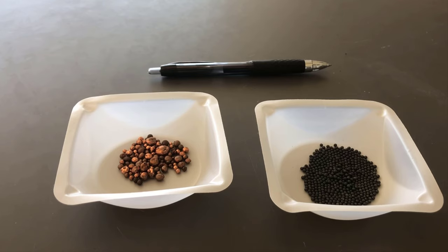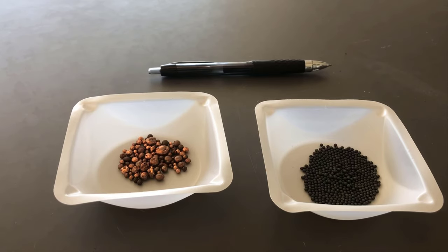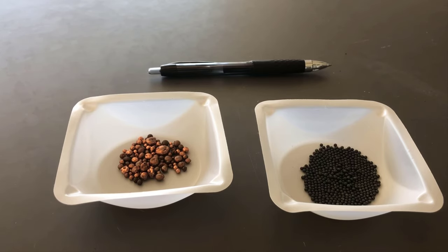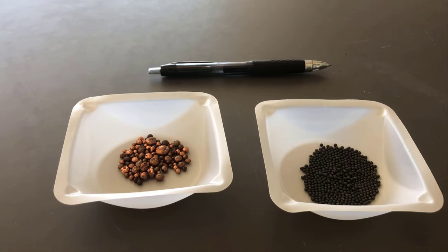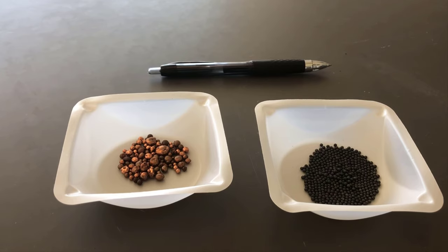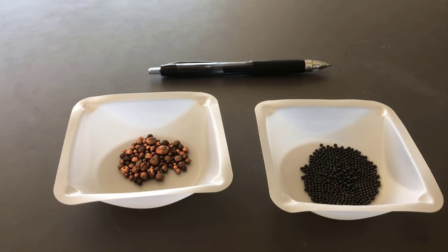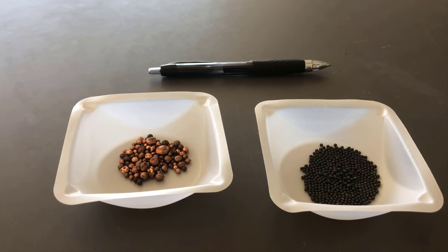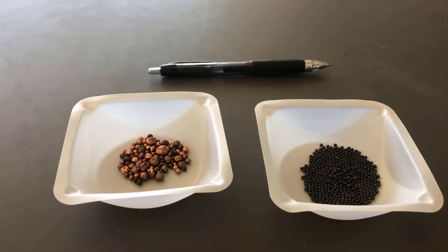Hopefully you've had a chance to have a look at the procedure — we'll get right on with it. The plan is that we're first going to heat a measured quantity of one of these metals, then add that heated metal to a measured quantity of water at a known temperature. One of these two substances is going to lose heat and the other will gain heat, because heat always flows from an area of higher temperature to an area of lower temperature. Furthermore, the heat lost by one substance is going to be equal to the heat gained by the other. Using these facts, we're aiming to calculate the specific heat of each of these two metals.